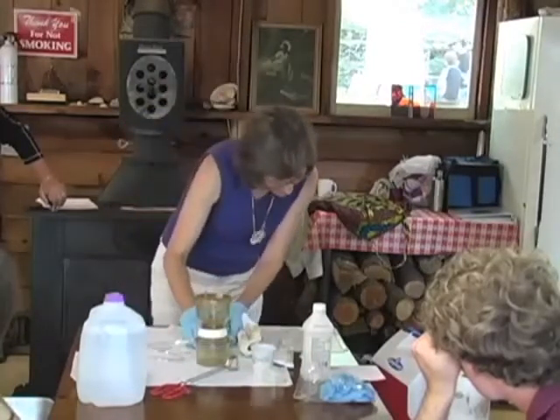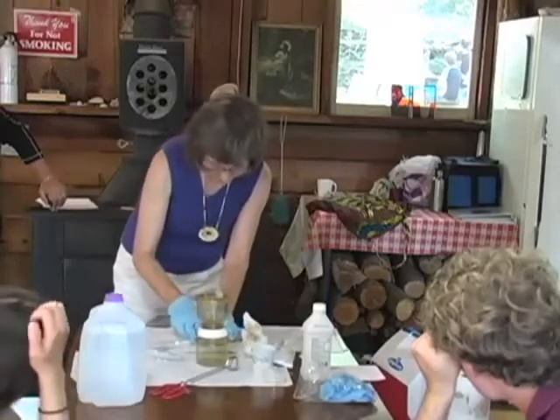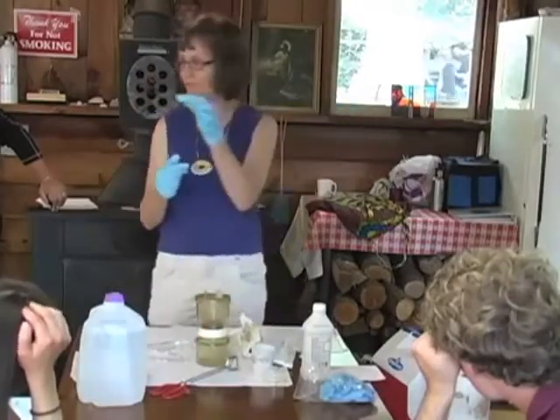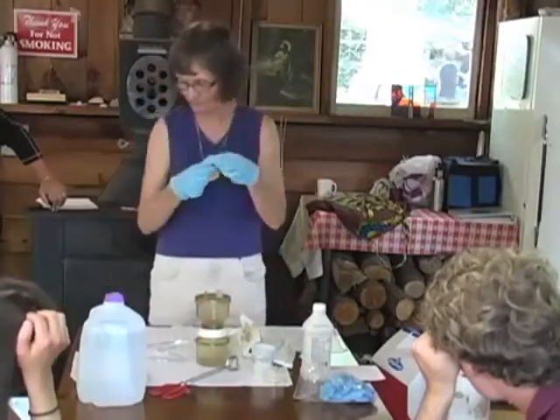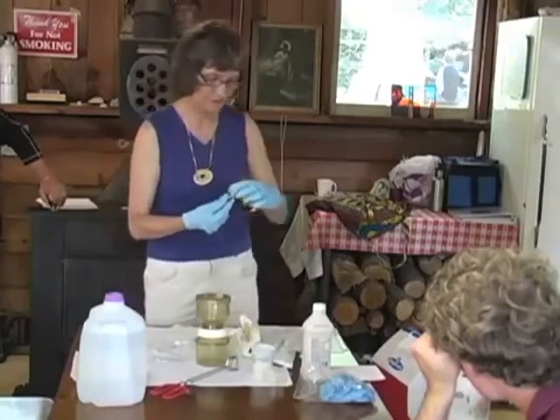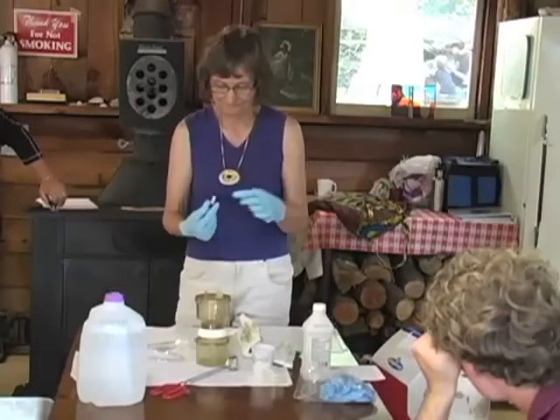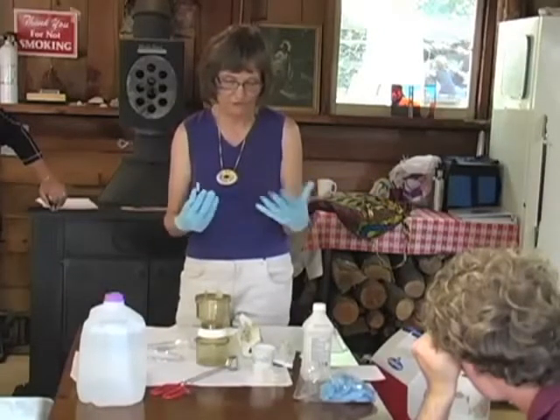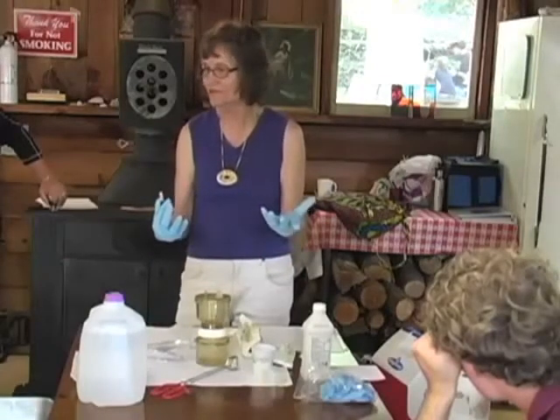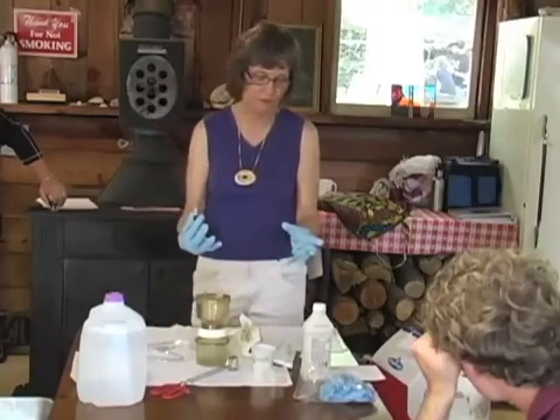Okay, so I think you just said 1 plastic ampule to a petri dish, right. Okay, so open this. This is the broth. This is basically just food for bacteria, something for them to live on and grow on. I'll do it all the first time. I was hoping to make it interactive and have people come up. And normally, if everything is sterile and you're handling it right, the gloves aren't necessarily necessary because you're not supposed to touch in the wrong place anyway.